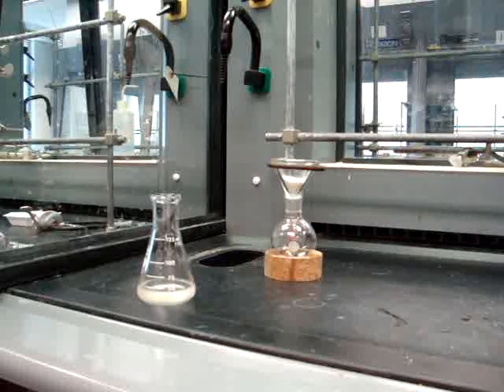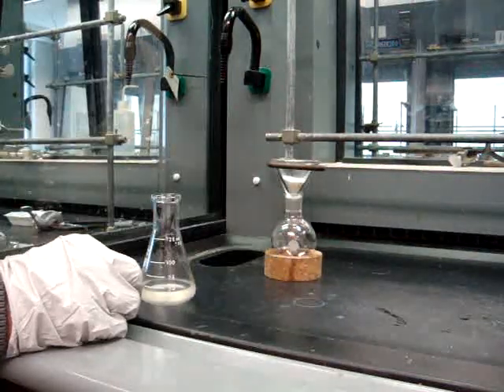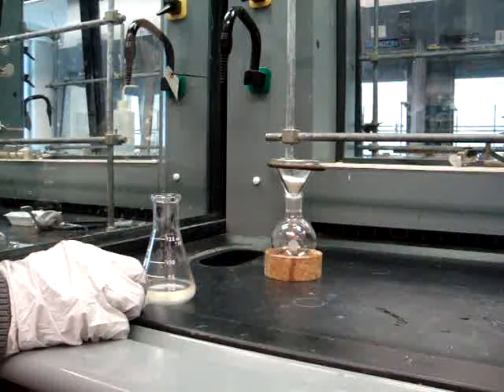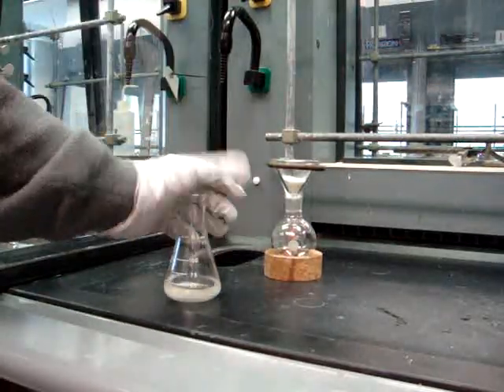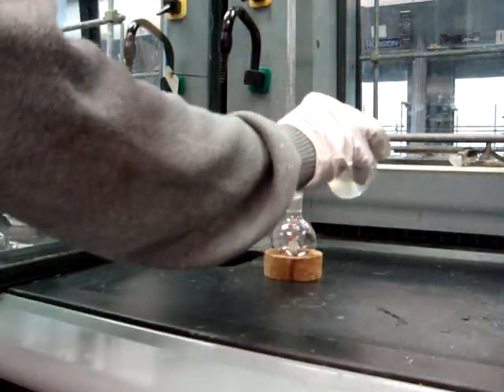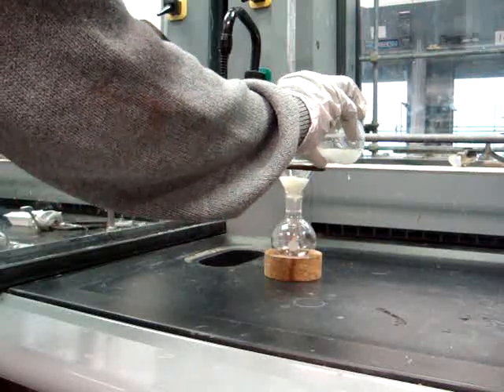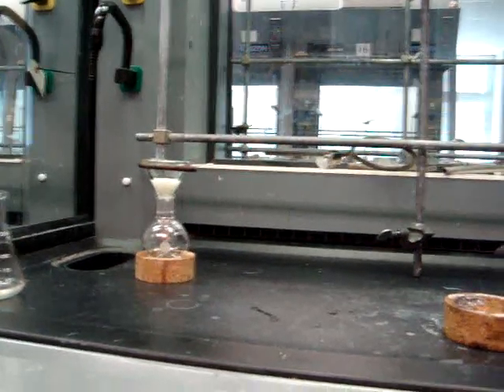Now you'll be drying your product over sodium sulfate and a cotton plug using a gravity filter, which you've used in the past. Refer back to the chromatography labs if you have any questions about this part of the procedure. Make sure you add a boiling stone to the flask so that when you put it in the rotovap, you will avoid bumping. You want to have your flask weighed out before you add your product. As you can see, the solution that comes through the filter is clear — if you get a cloudy solution, you'll have to redo this.